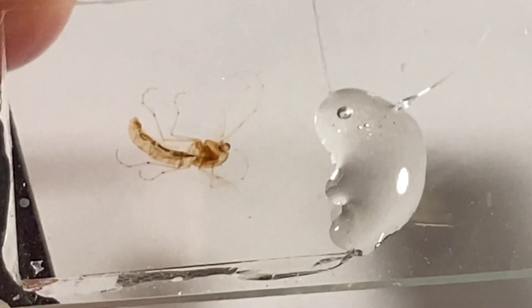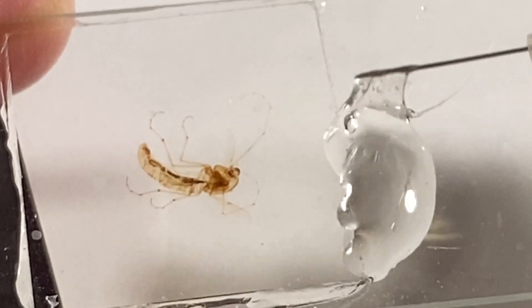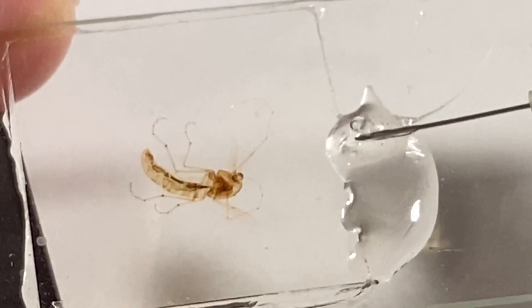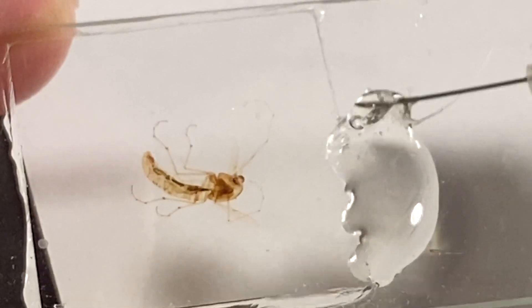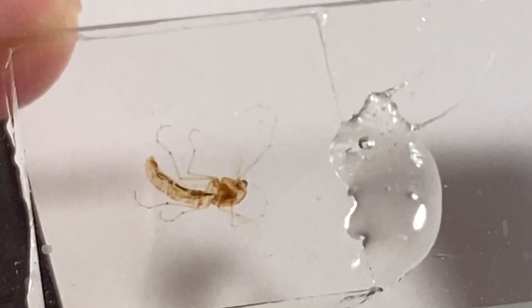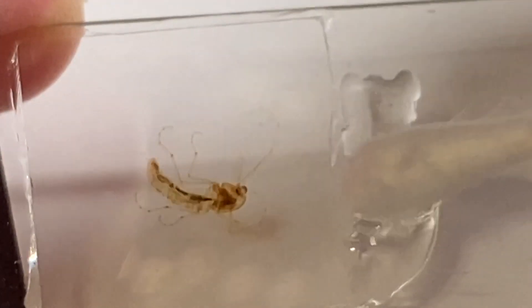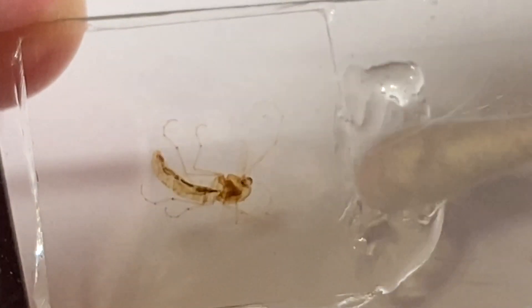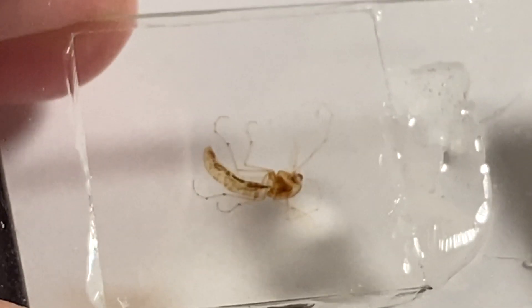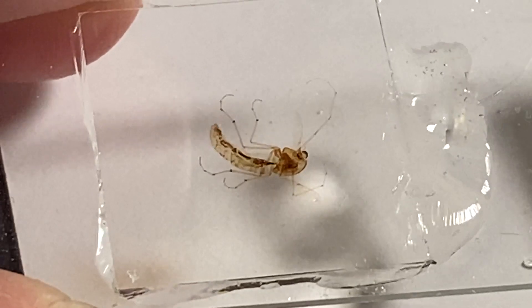I just almost dropped my camera. I'm not a very professional outfit here, but we get rid of that bubble. Come on, bubble — when you want the bubble to pop, it won't. So I think what I'll do is take a Q-tip and move it out of the way. There you go. Oh, I see — I created another one. I hate bubbles. It just ruins the professional part of the slide.